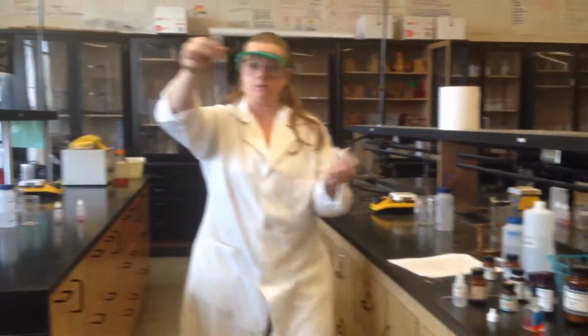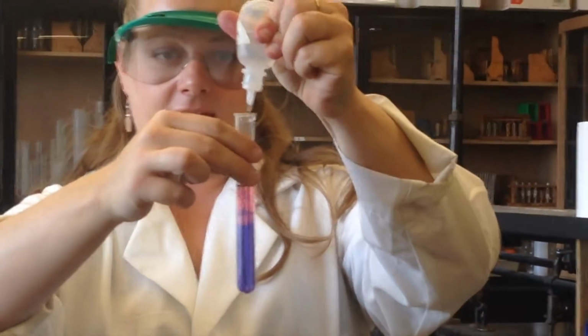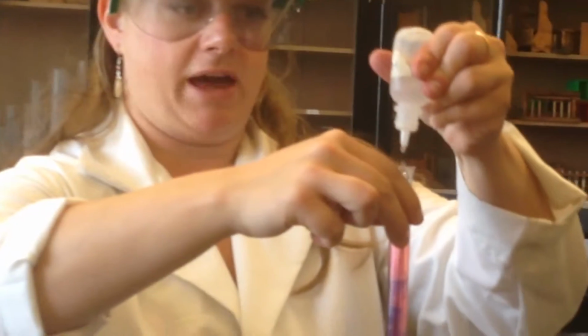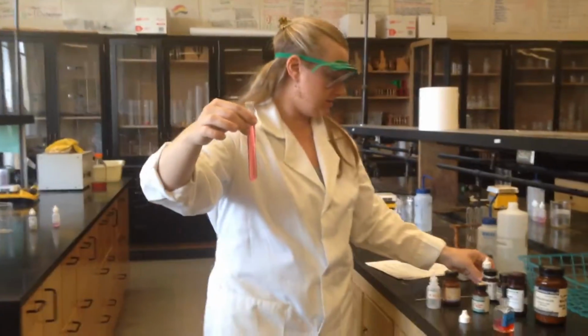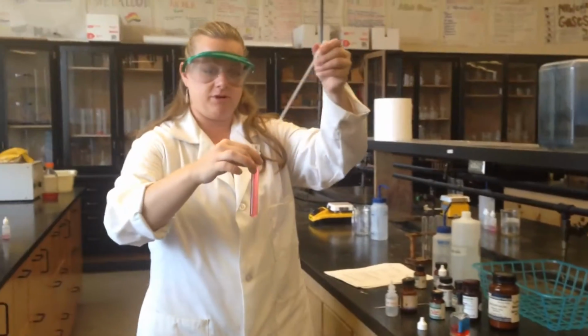Okay, so it turned from blue to purple. Let's see if we can get it to change color. There we go. All right, oh, fancy. Whoa, wow. It's kind of turning back to that red. If I were to keep adding acid, would we get it back to the original color? Yes, we probably would. Can I turn it back to blue, do you think? Yes. Let's see. Can I turn it back? Ooh, I just add more of this.